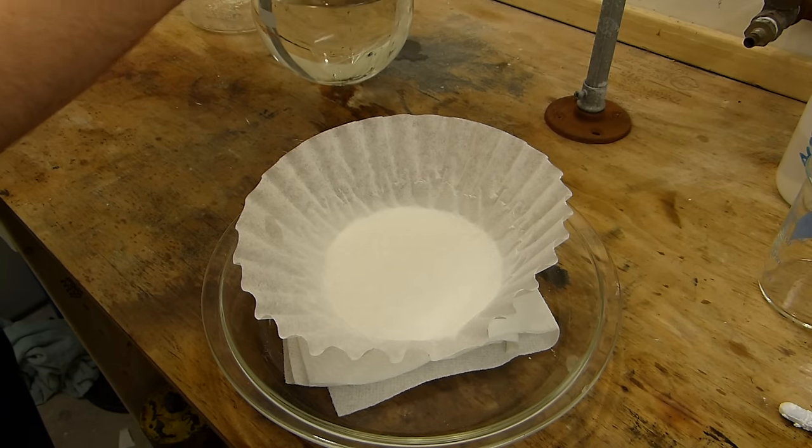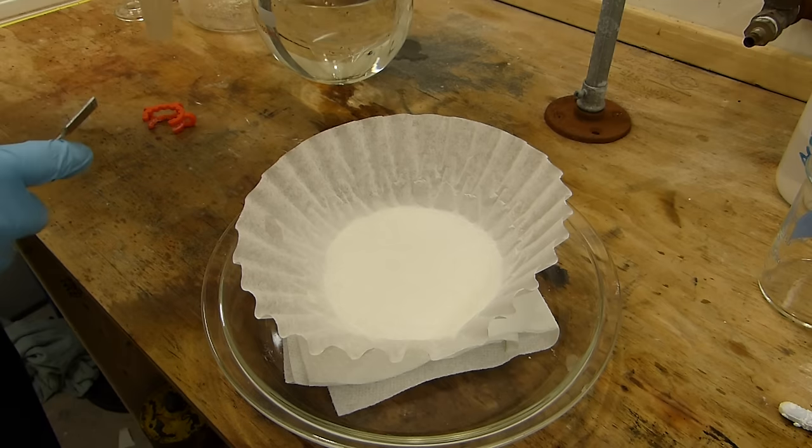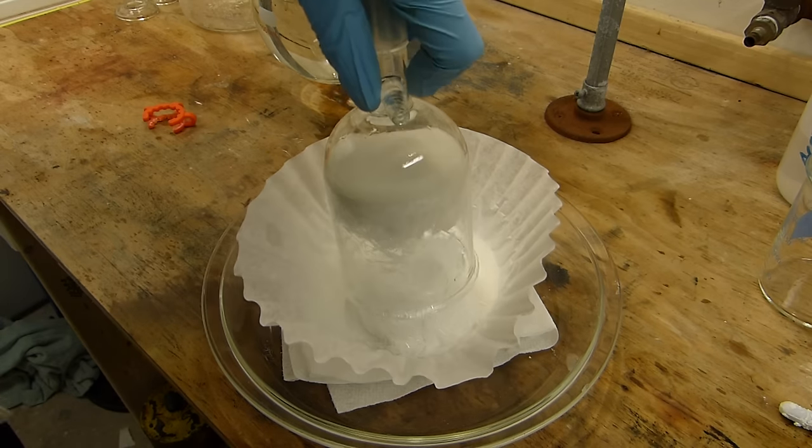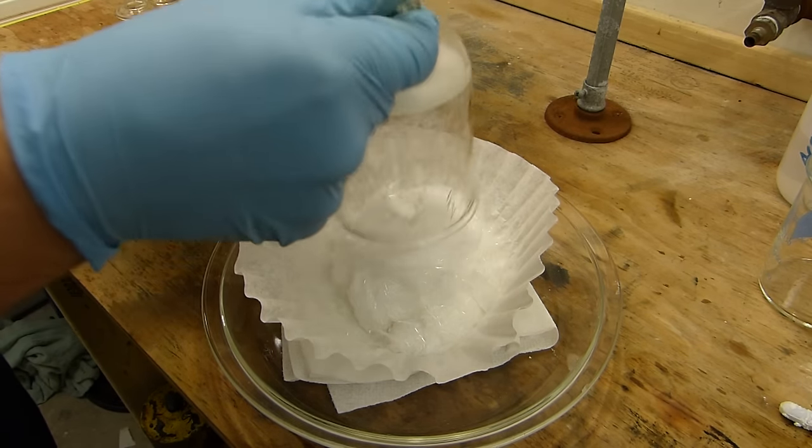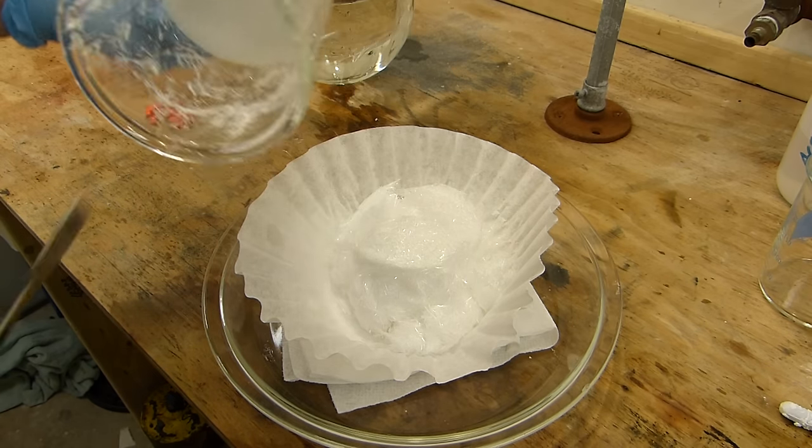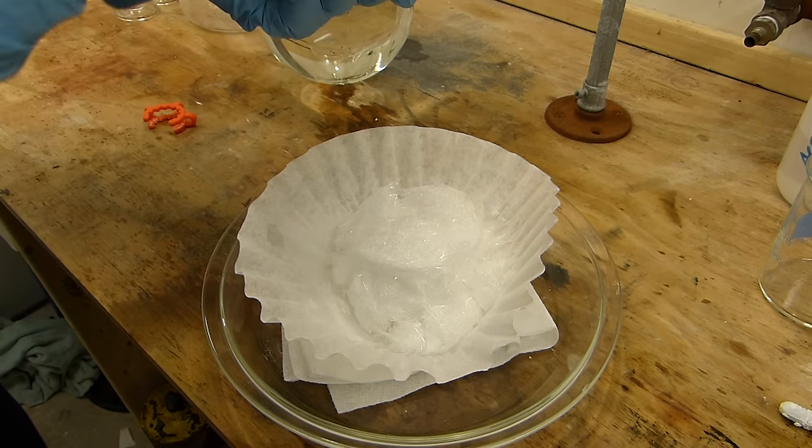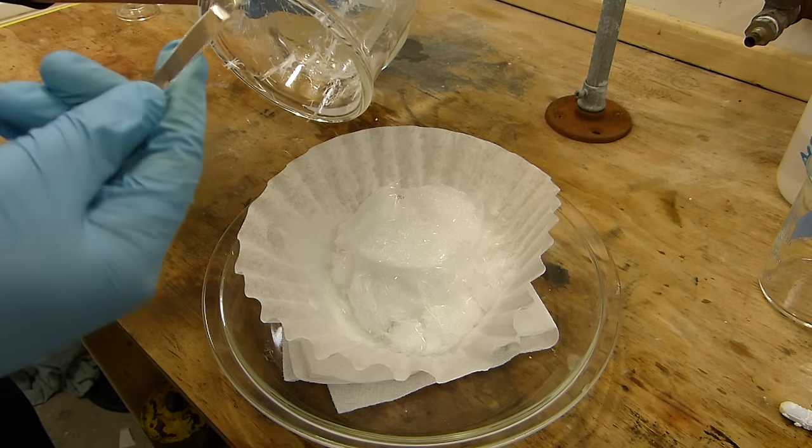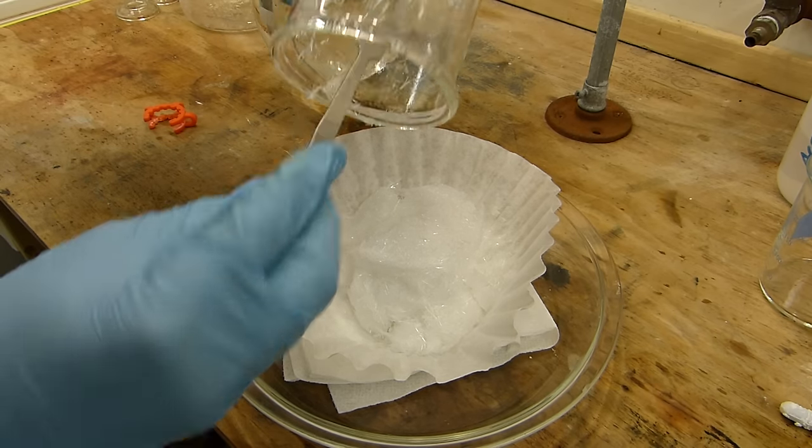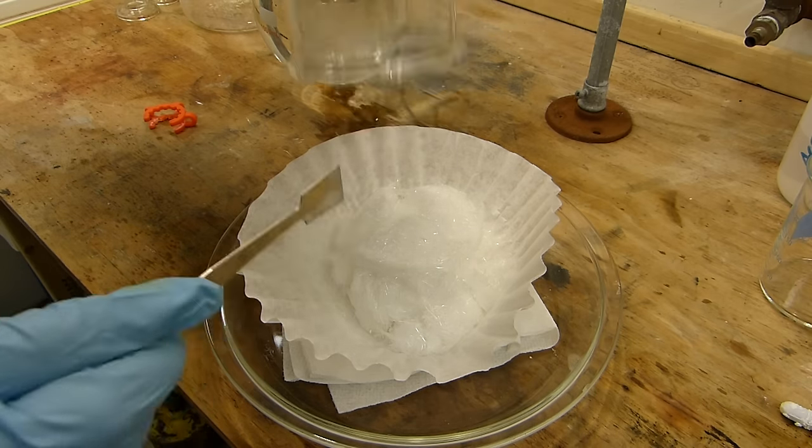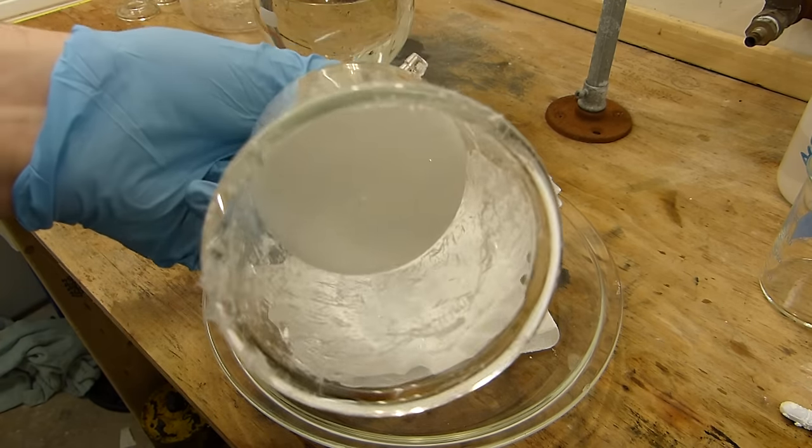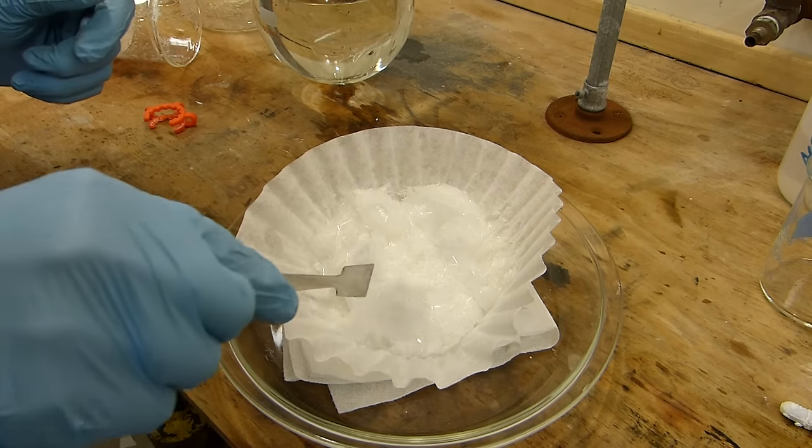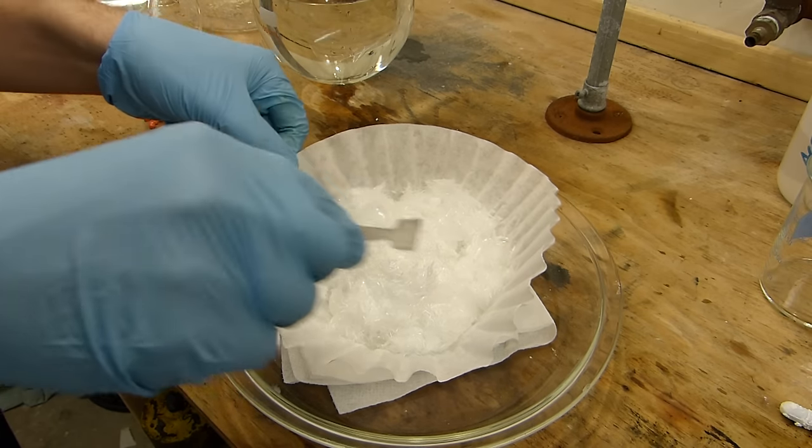Okay, and we're back to the old paper towel trick. Any benzoic acid crystals? These should probably just dump out the thing. Good. Oh yeah, there we go. Look at that. Almost clean. Do a little bit of scraping, maybe. I don't want to gouge my frit with this stainless steel spatula, either. Yeah, you know, that's good enough. I got 99.9% of it. Here is the mat of fine needle-like crystals. It looks almost like glass wool.